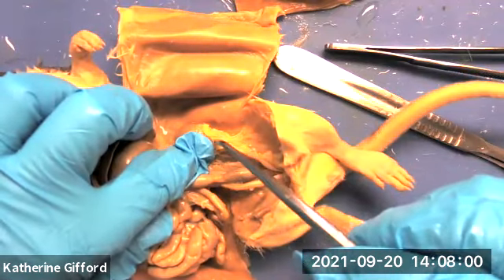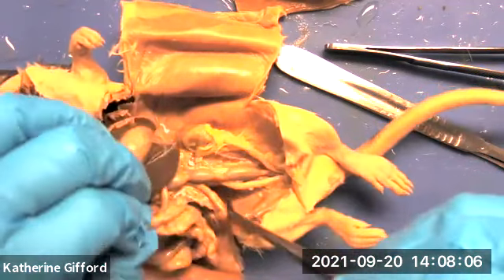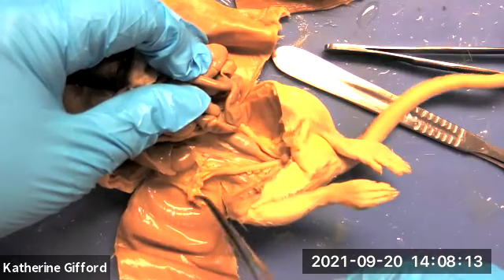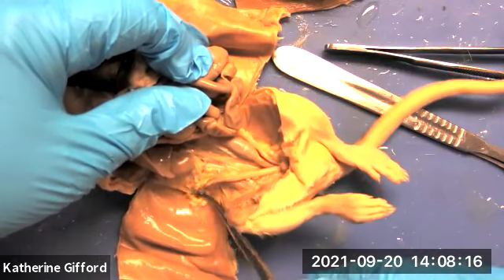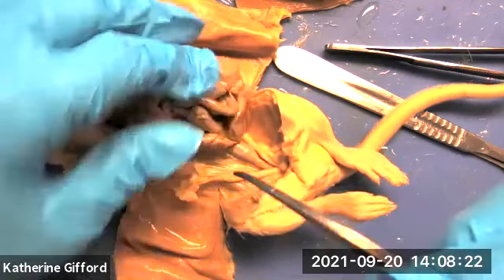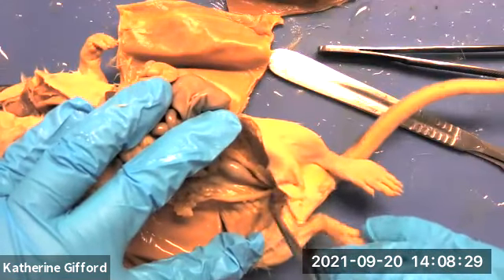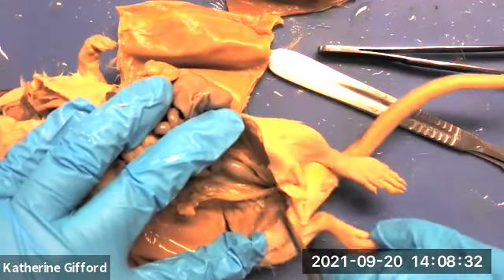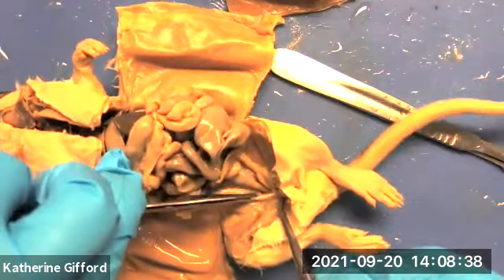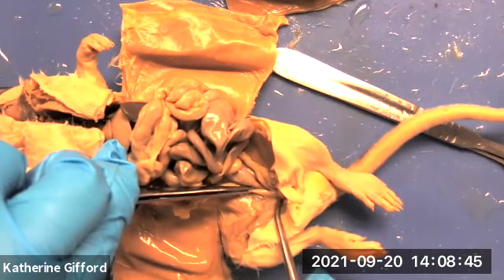There's a mass of tissue here which is the ovary. We flip everything over — same kind of thing. We remove some of the adipose. The ovary has a very uneven surface. The two uterine horns are going to unite in the body of the uterus, and then that's going to narrow and go into the vaginal canal.